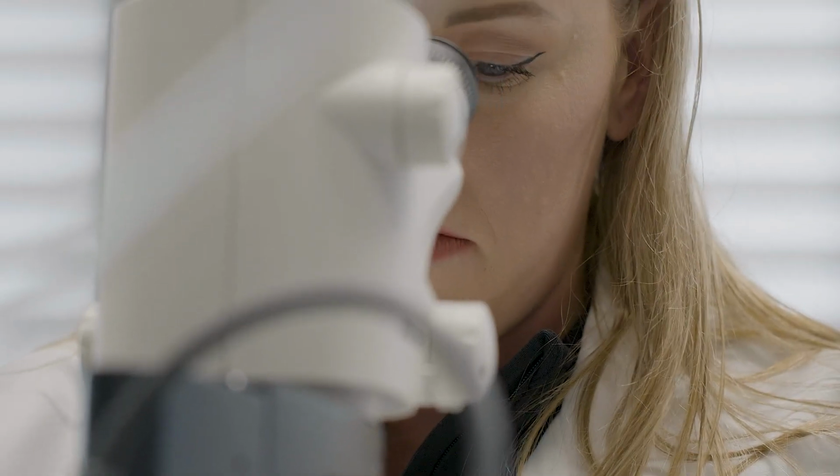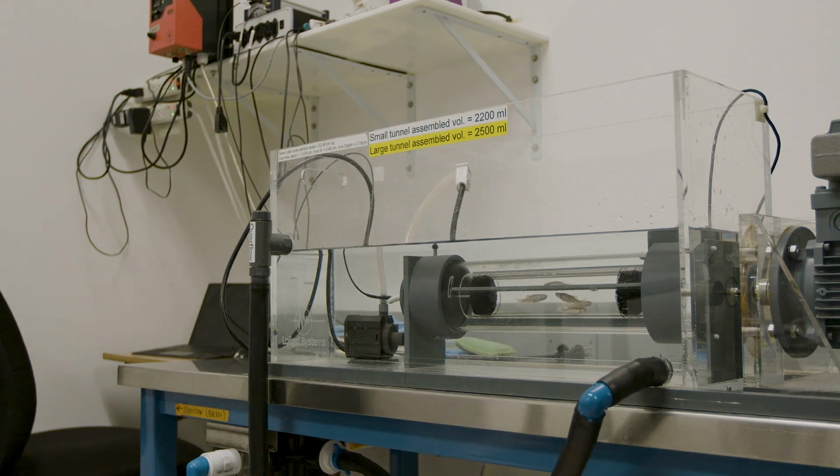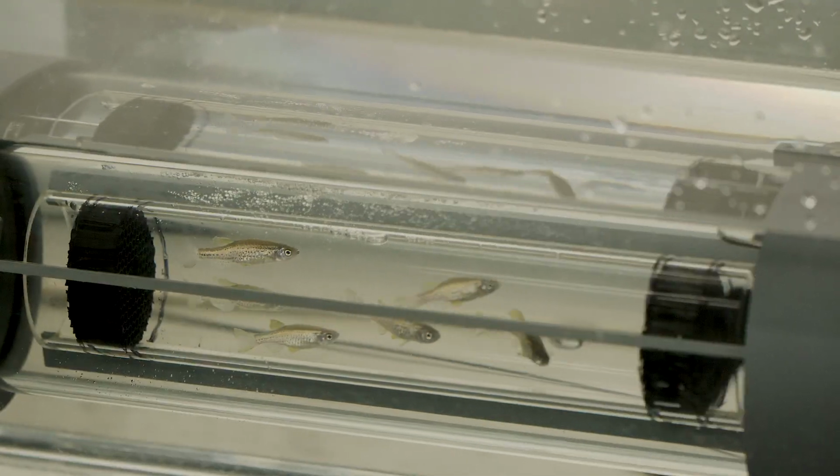You can roll out new methods, you can compare them to traditional methods, you can have revisions in your methods, and there's a reproducibility loop, again, where you can test something and then actually ask, did that work going forward? And that predictive loop, I think, is really powerful. Within this lab, Dr. Tanguay really fosters a sense of integrity and independence in the researchers, but together we all act as a team. So each person wants to see each other person succeed.